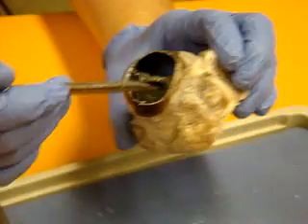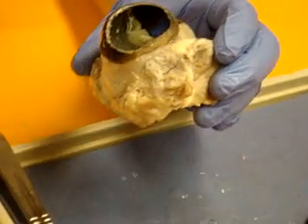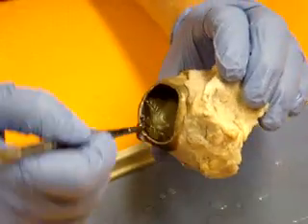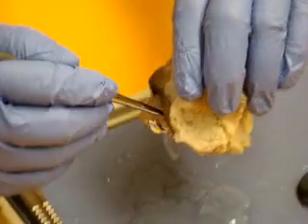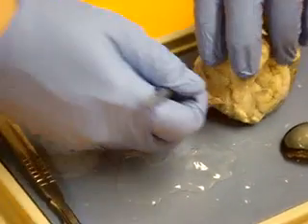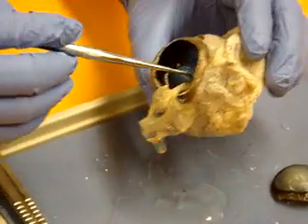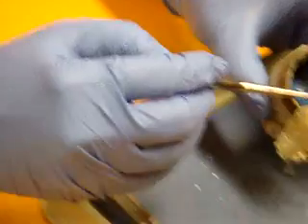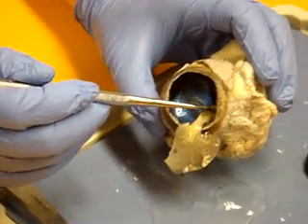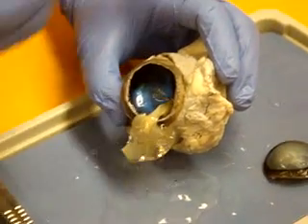There's the retinal layer right there. The choroid would be that inner layer. Now if I pull the retinal layer off the choroid layer, you can see how it all kind of collapses. It'll come off the sides pretty easily, except for right there — that's the optic disc. That's where the retina goes through the optic disc and becomes the optic nerve passing that way.